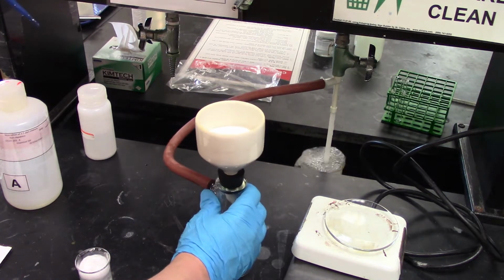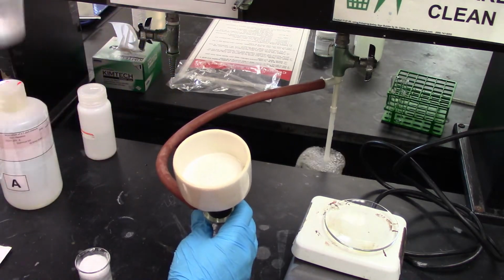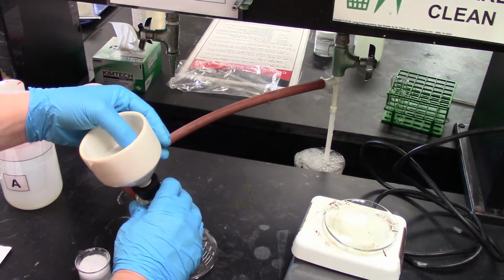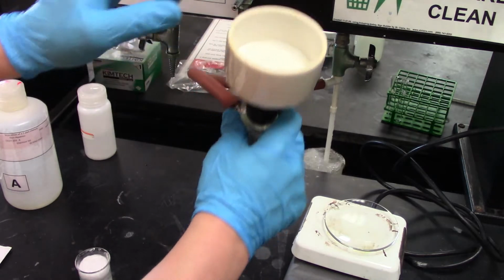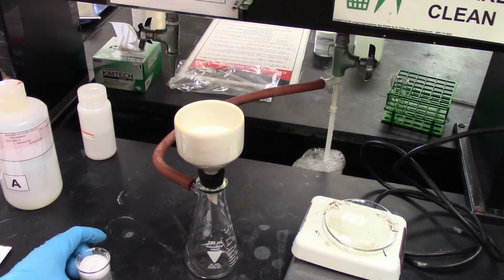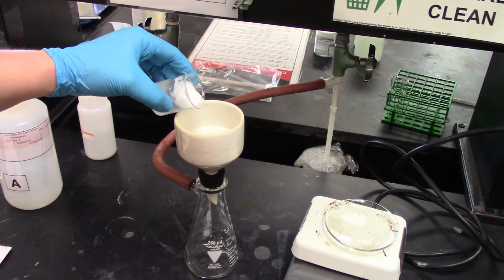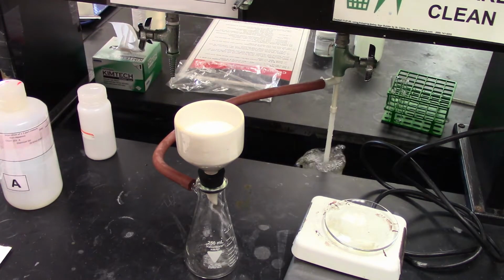So we're going to take our filter paper, this has been pre-weighed, and I'm going to add some deionized water to it, and make sure that we get a good seal all around. So if I look at it, I can see all the holes are plugged, and you can definitely see the water getting sucked through. And now I'm going to take my solution A, and I'm going to pour it into this flask, preferably slowly. You can kind of see I just kind of dunked it in by accident.